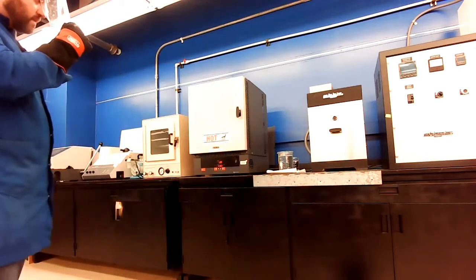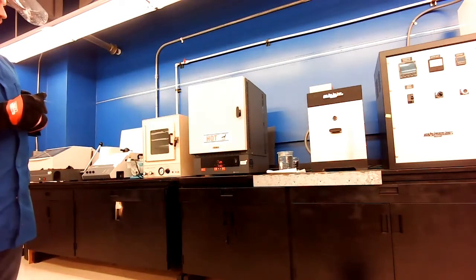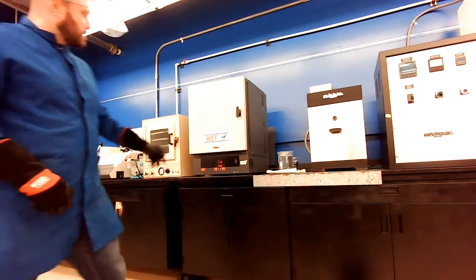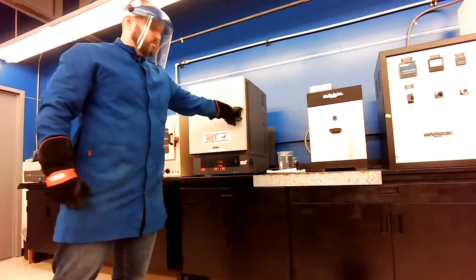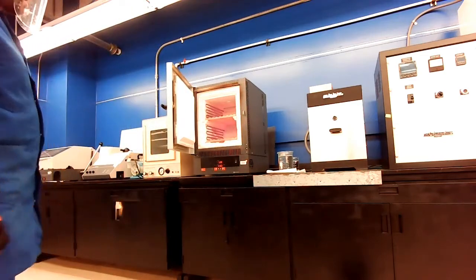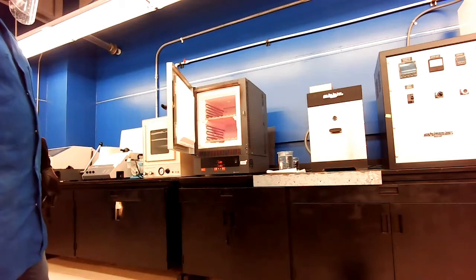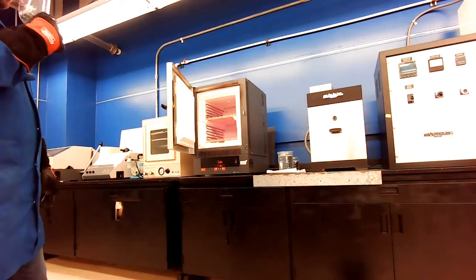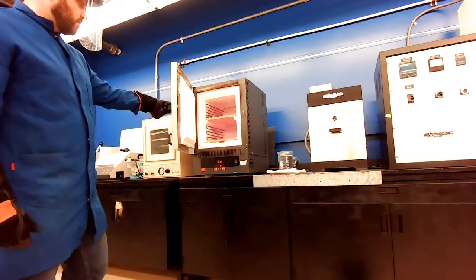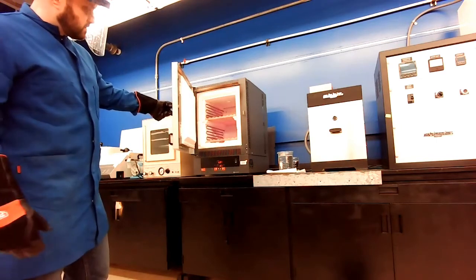See what my temperature is doing. It's going back up a little bit. So I might open it and reduce the temperature a little more. My goal here is I don't want to go below 650. I want to ramp down relatively fast and stay there.